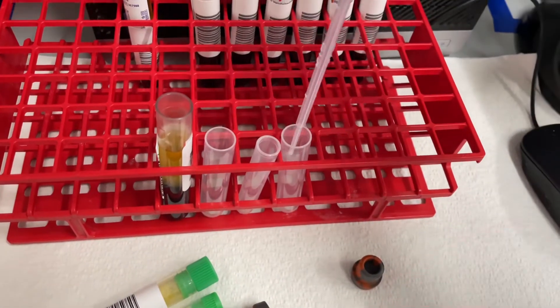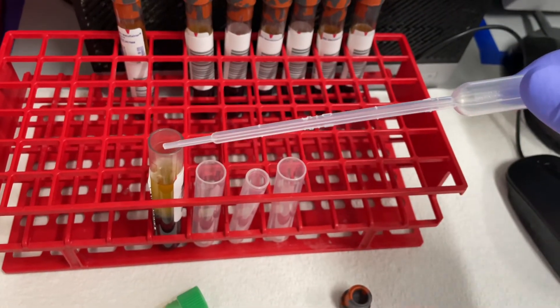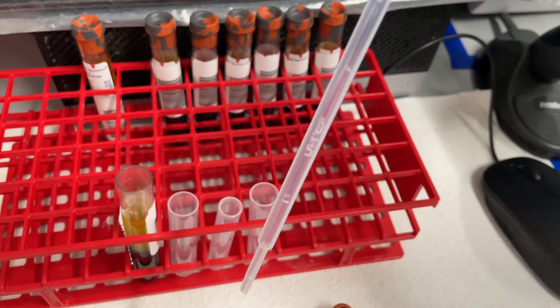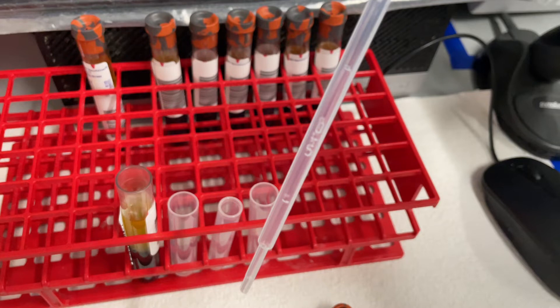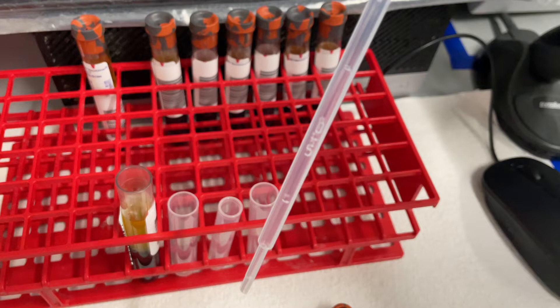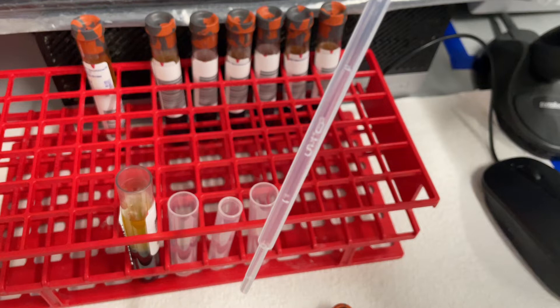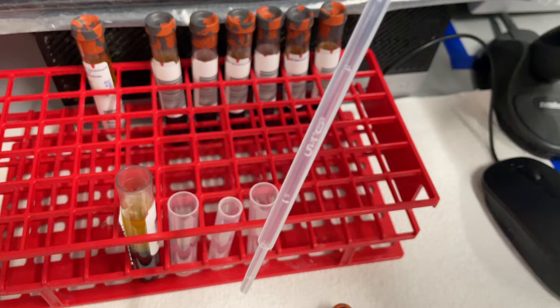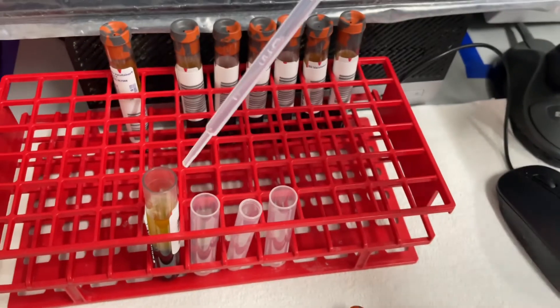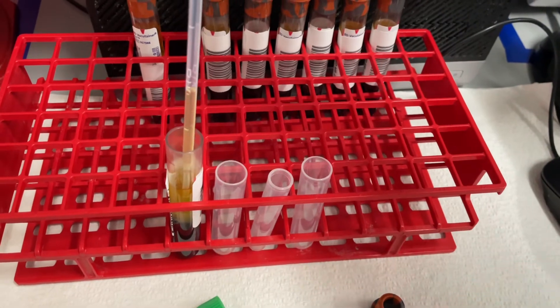This process of processing is very tricky. Make sure you wear all of your PPE gear, understand how your pipette works, and know its delivery volume before you use it. Never allow the serum, plasma, urine, or any bodily fluids to enter the bulb part. Make sure you pause after aspiration and immerse the tip to the proper depth. I've seen people get bodily fluid in their eye or on their face, so please make sure you are properly wearing your PPE before processing any specimen.